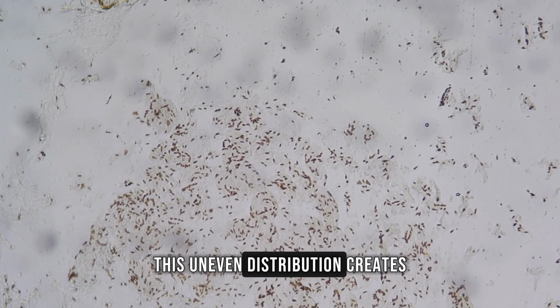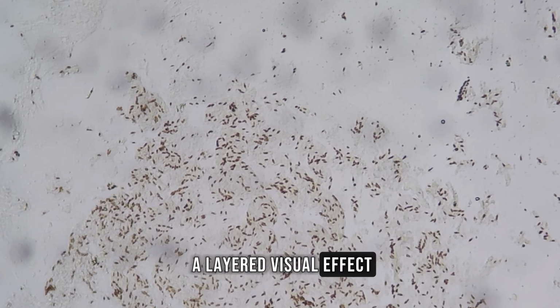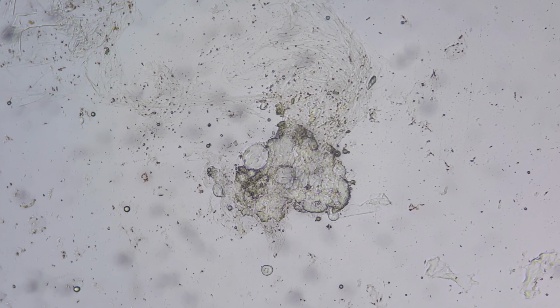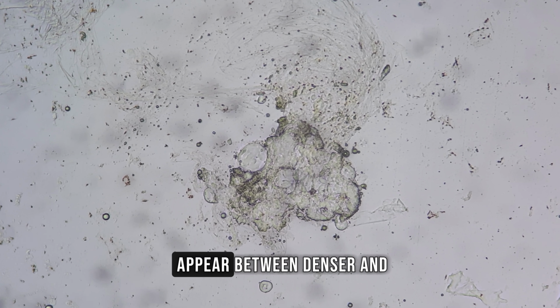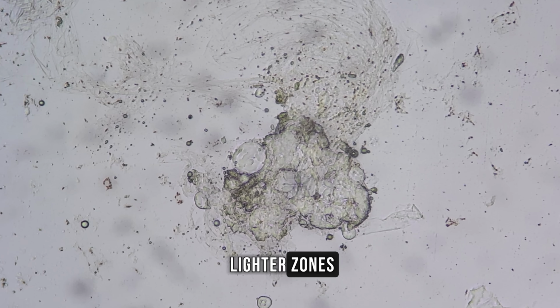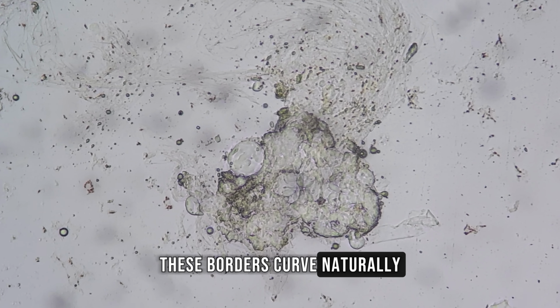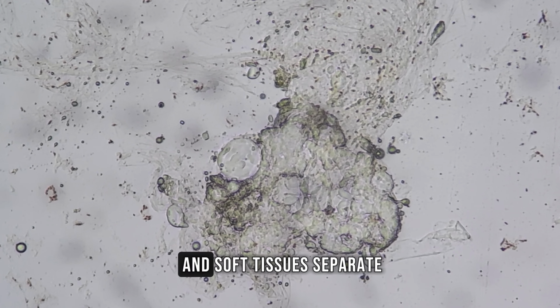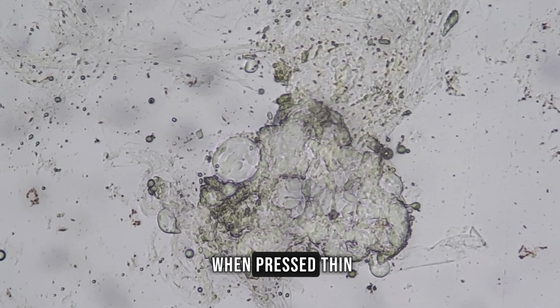This uneven distribution creates a layered visual effect. The sample feels segmented rather than uniform. Soft borders begin to appear between denser and lighter zones. These borders curve naturally and do not form straight lines. They suggest how liquid and soft tissue separate when pressed thin.